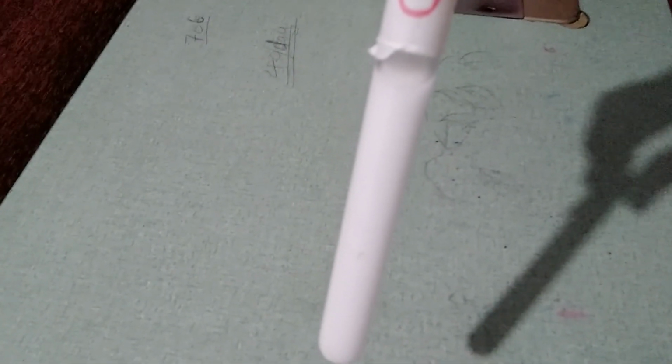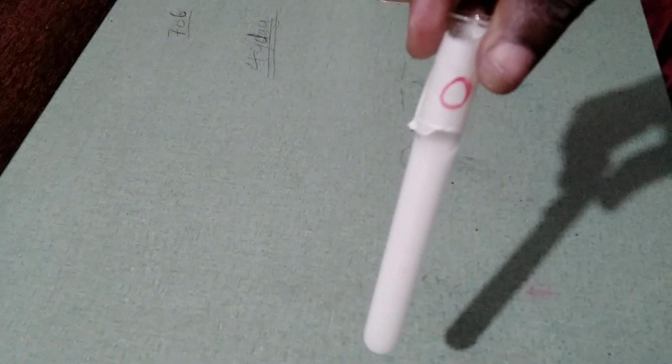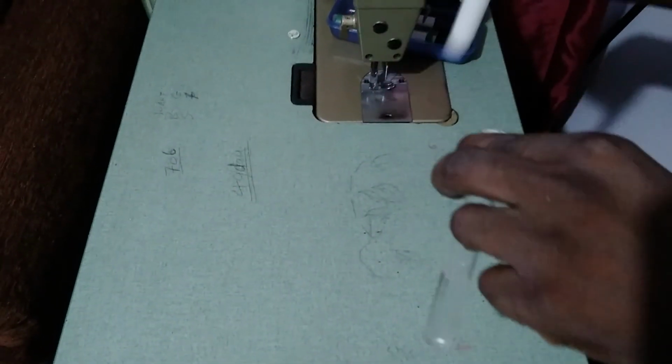So that is the mixture well shaken, and we're going to be adding that to 5 ml of water, and you will observe what happens when we add this mixture to water. So we're going to be adding it now to 5 ml of water. Please make your observation. Alright, so you need to record what will happen now. Look at what happens.